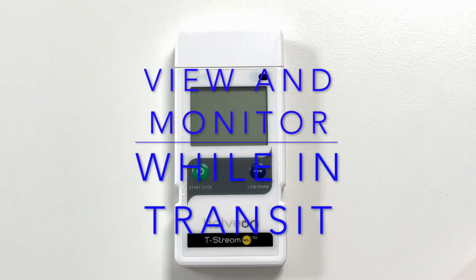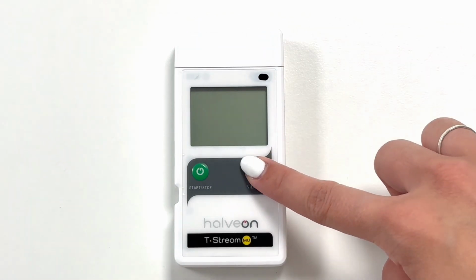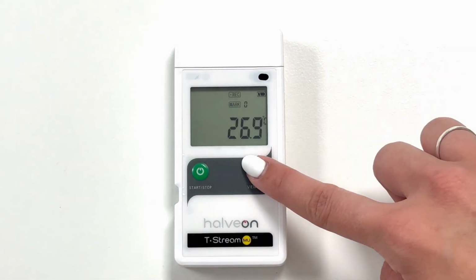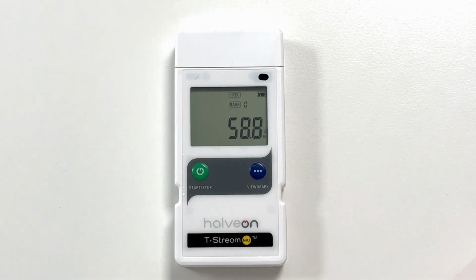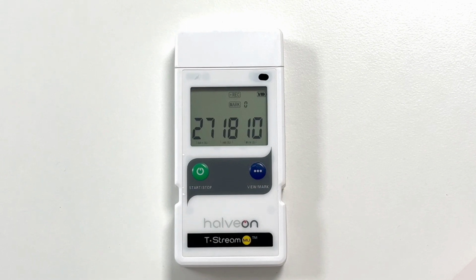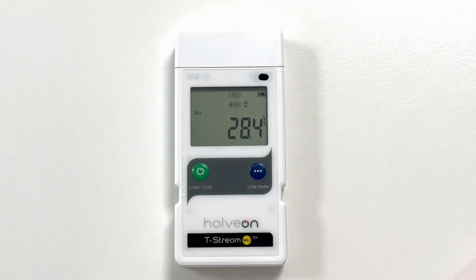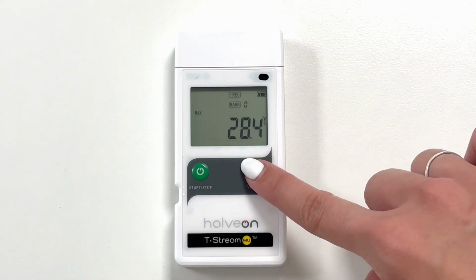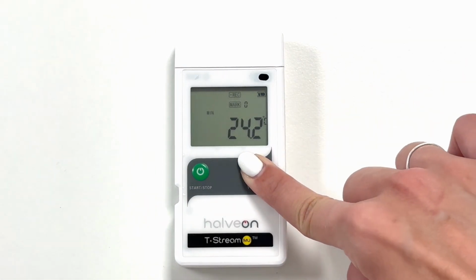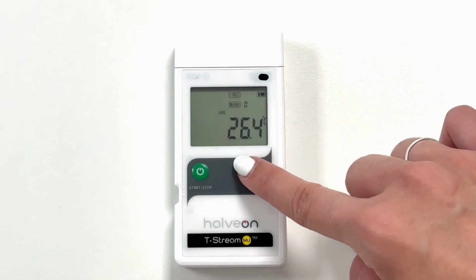Part 4. View and monitor while in transit. To check the logger during the recording process, the user can press the View Mark button at any time to monitor the following items: the actual temperature being recorded, the humidity being recorded, how long the logger has been recording, the maximum temperature recorded, the minimum temperature recorded, the average temperature recorded, and the average kinetic temperature recorded.